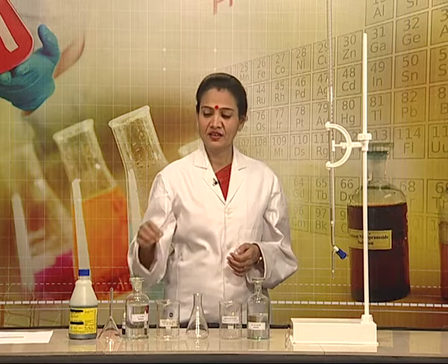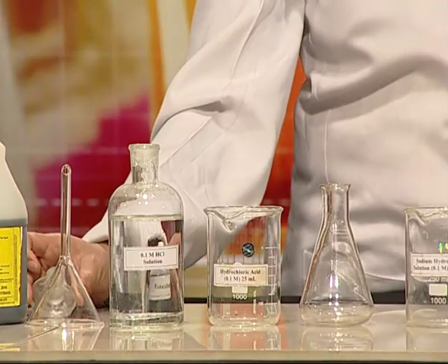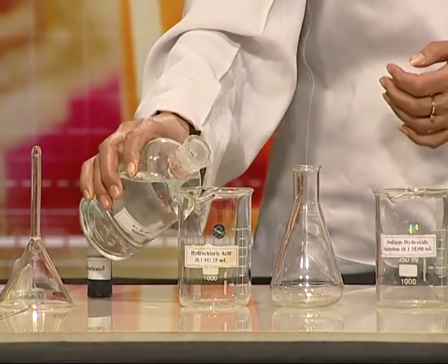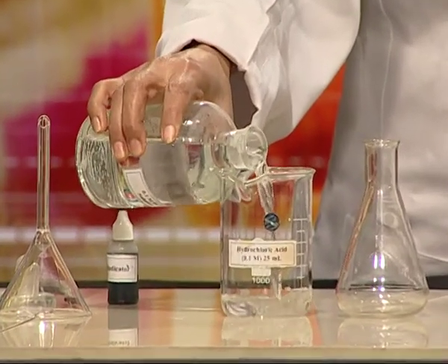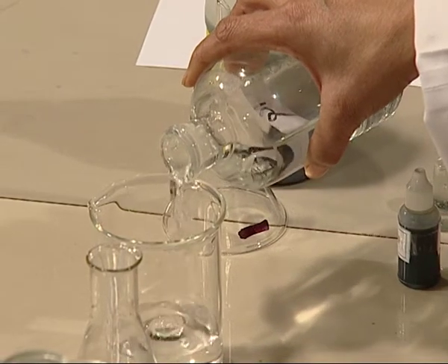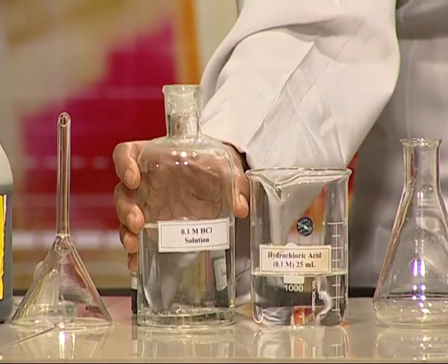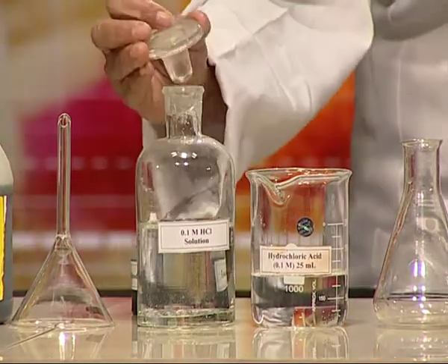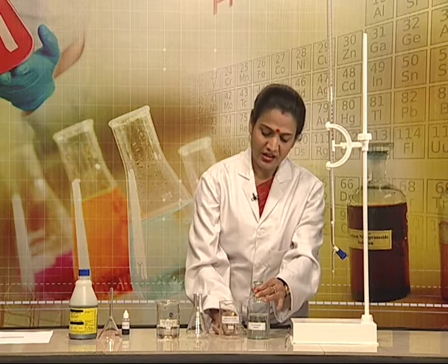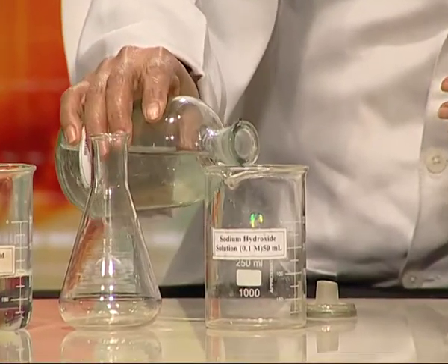Let us take these stock solutions into beakers. This is hydrochloric acid solution. And now I am pouring sodium hydroxide solution into the beaker.